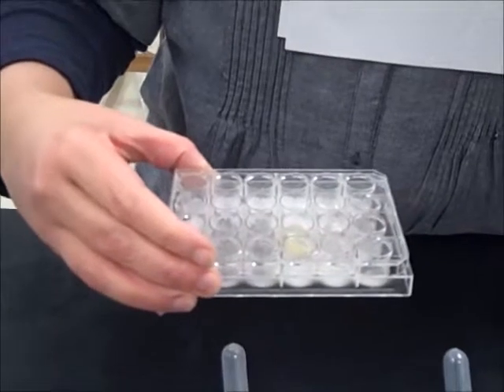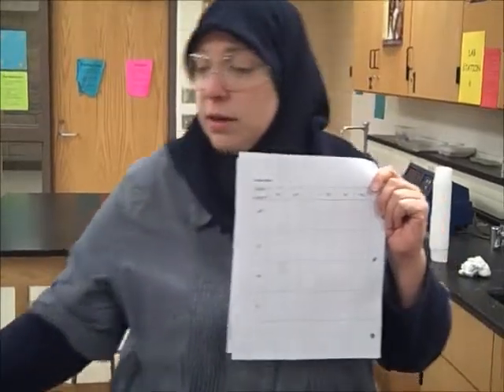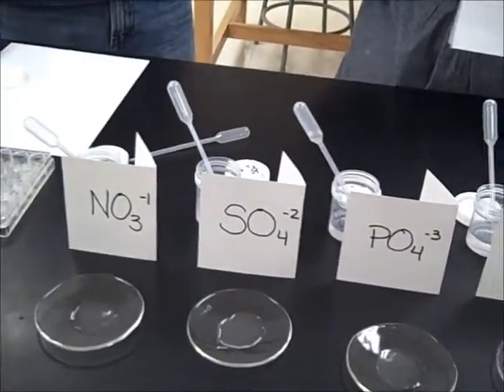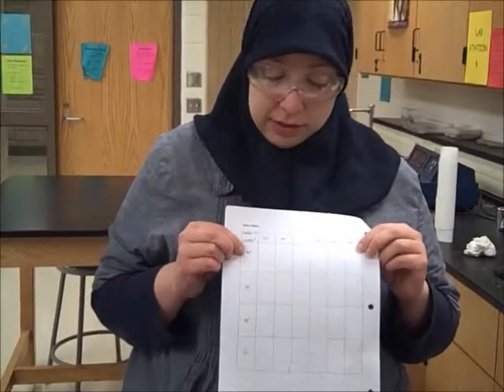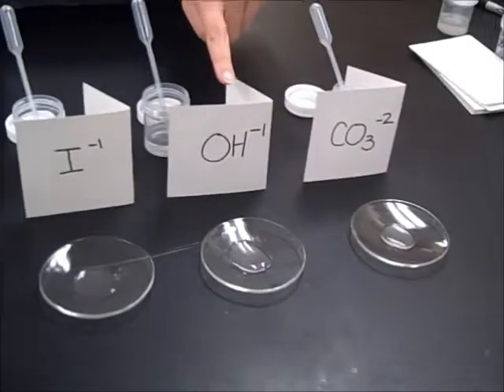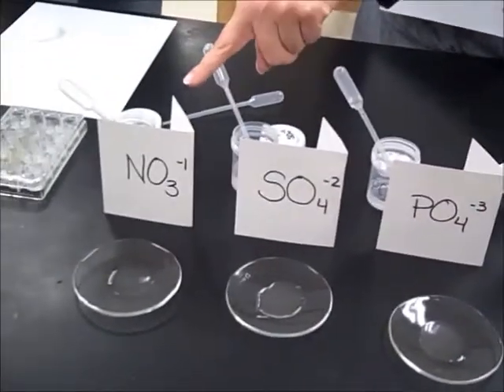So it's in grid form. Unfortunately, the equipment that we used in class, which was a reaction well, is too small to get a really good view of the reactions. So we went ahead and did our reactions in reaction or watch glasses. Our first ion we're going to test, first positive one, because we're testing 4 positive and 6 negative for a total of 24 reactions. Our first positive one is Ba, barium, and we're going to test it with 6 different anions, which are listed here: the carbonate anion, hydroxide, the iodide, the phosphate, sulfate, and the nitrate.